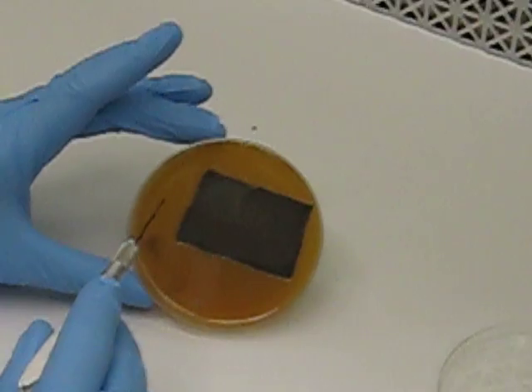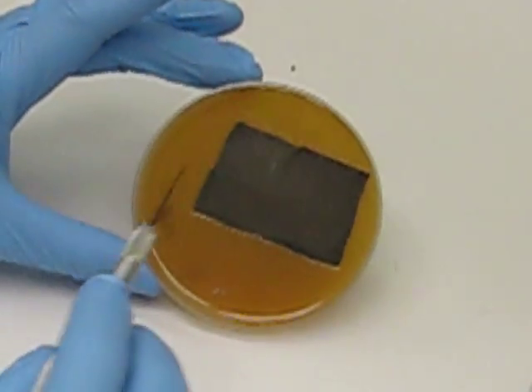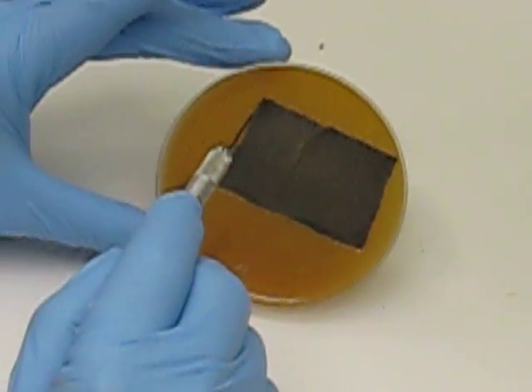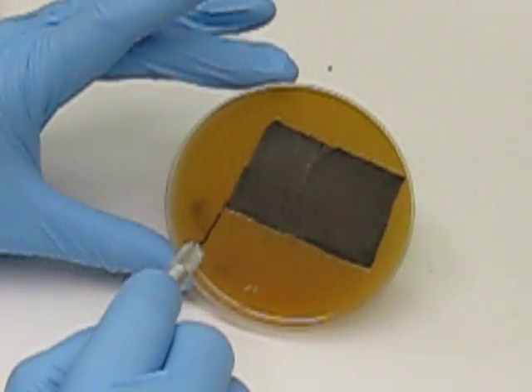When you have a Cercospora plate, make sure your tool's cool, and excise a small portion, preferably a square or rectangle, carefully from the media.